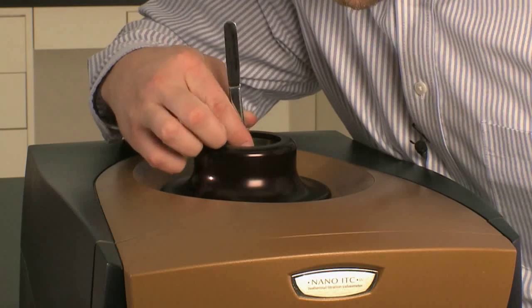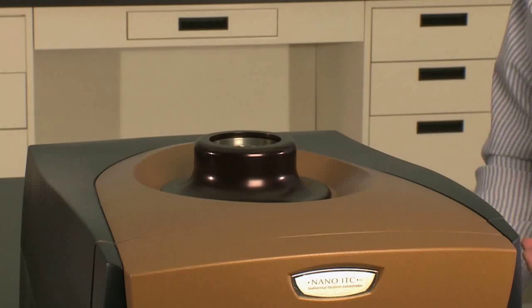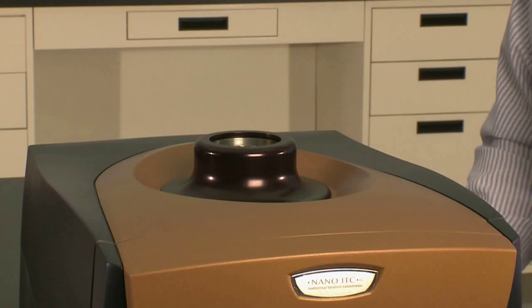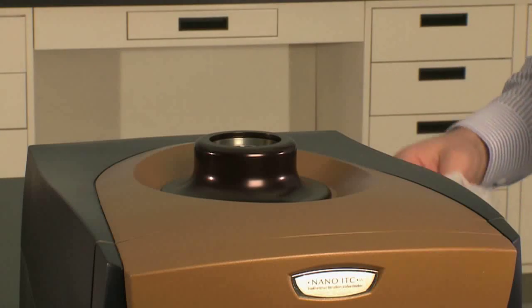I'm removing the reference needle out of the cell. You want to make sure there is no liquid left inside of the reference needle.